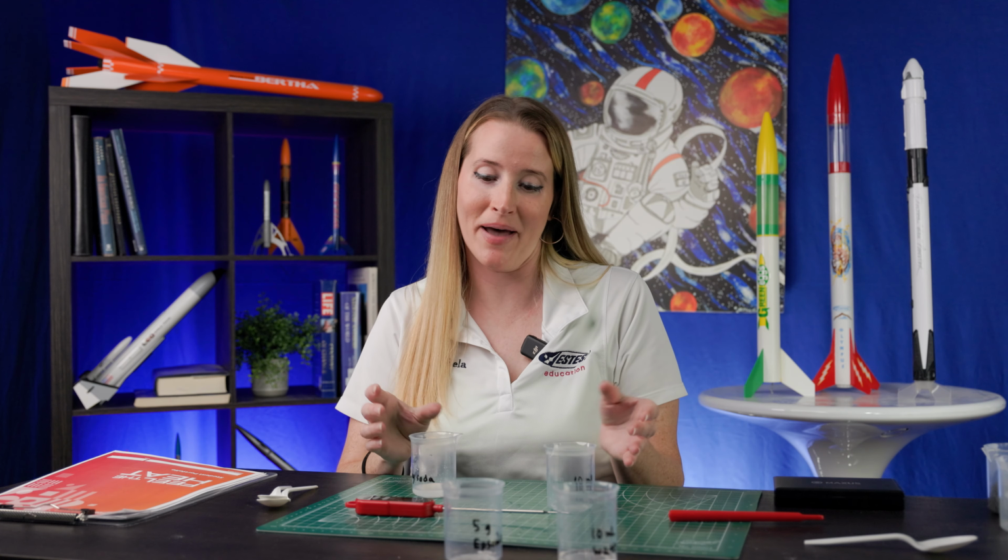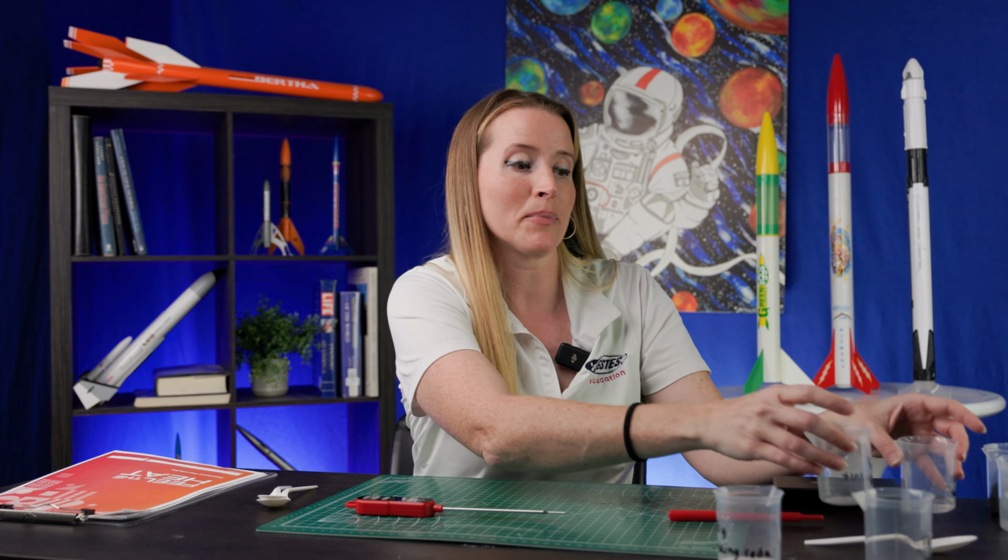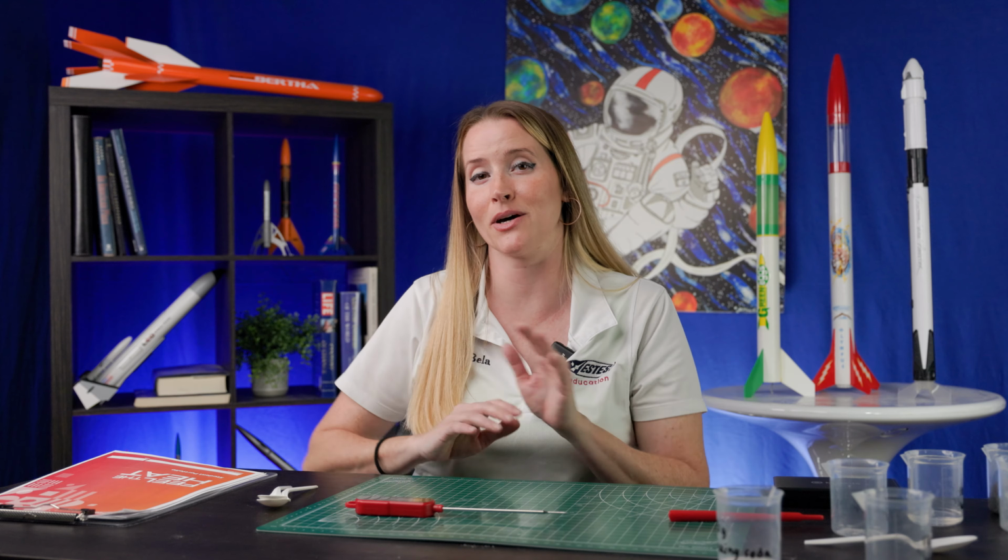So which combination might keep our astronaut the warmest? In the studio today, we're gonna go with hydrogen peroxide and dry yeast. It had a temperature increase of over 14 degrees Celsius. When students design their own astronaut hot pack, they'll use 10 milliliters of liquid like we did here in the studio today, but they can use up to 10 grams of their chosen solid also.